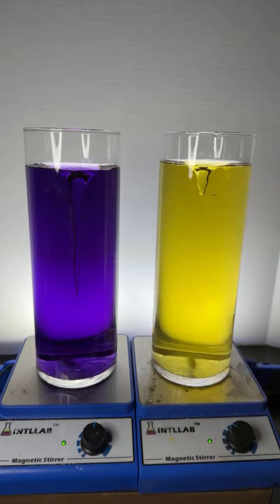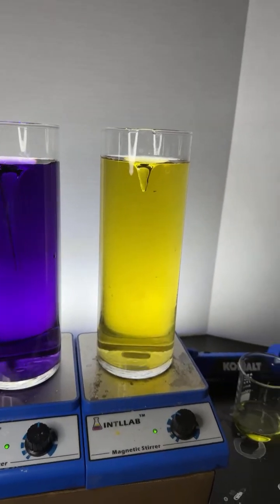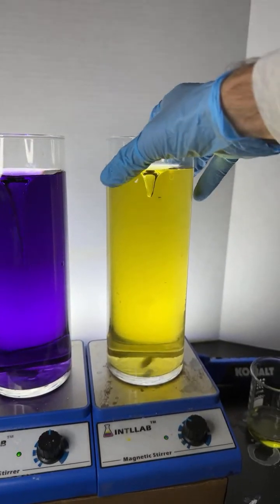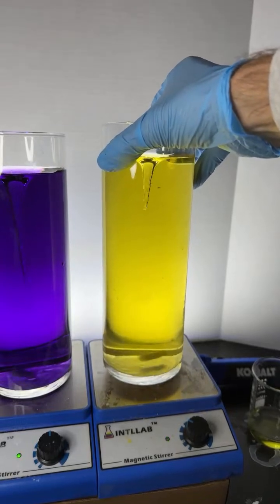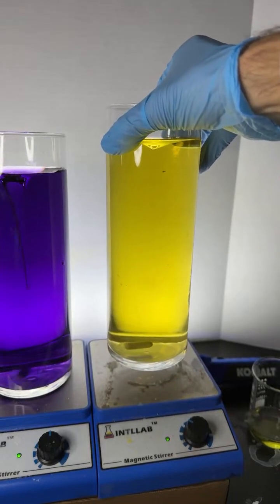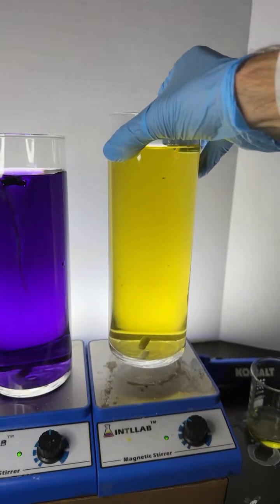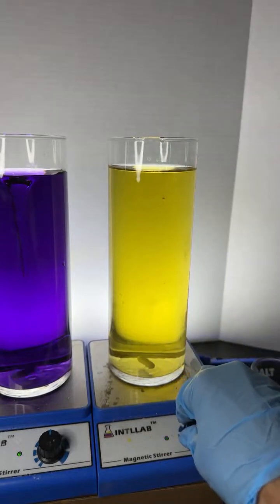Will the magnetic spinner keep spinning if I raise the glass a bit? What a great question. Let's find out. That's a new question. Here we go. We're going to raise up the glass off of the spinner. How high can we go? It's still fighting. Oh, there, it knocked out. I'm going to say about 2-3 centimeters above the spinner.